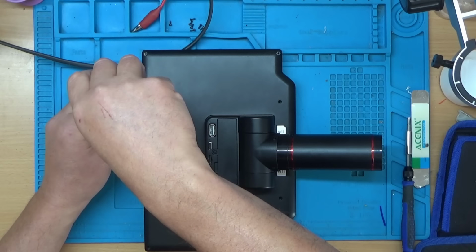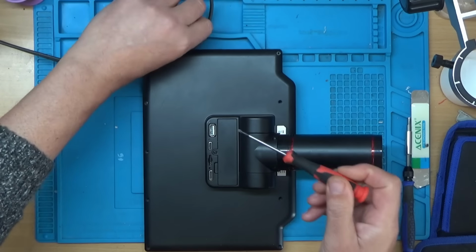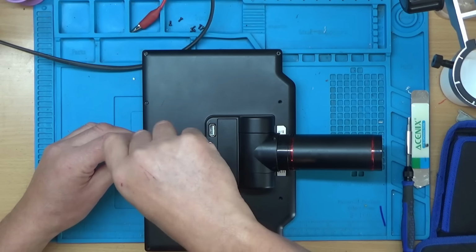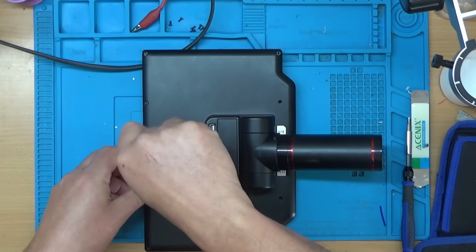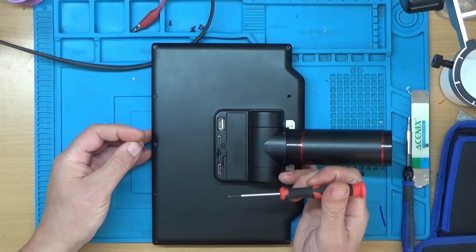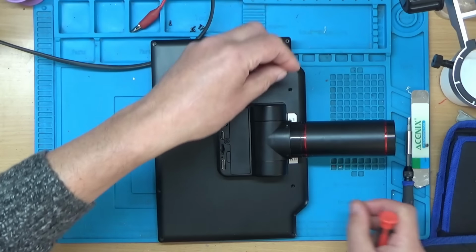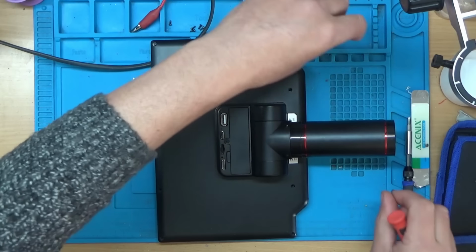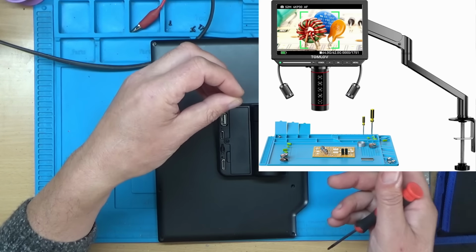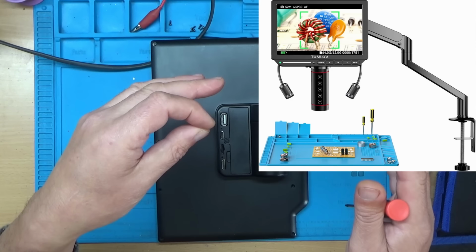So I've just clipped the case back together. I'm just putting the screws back in now. And one thing that they mentioned in the email as well is that they're bringing out a new version of the AF Flex, which is the autofocus flex version of the microscope. And what they said was they've listened to customer feedback, and instead of the ring light on the end here, now they've got two LED lights on movable arms, so you can set the lights at different angles so you can see things like chips and that better. And they've also improved the actual articulated arm that the microscope goes on.